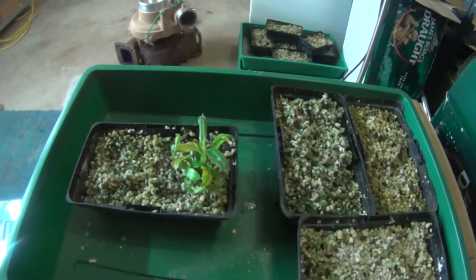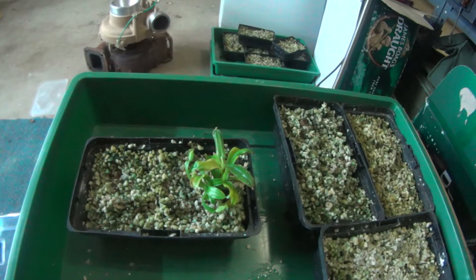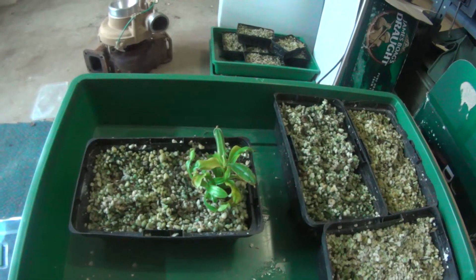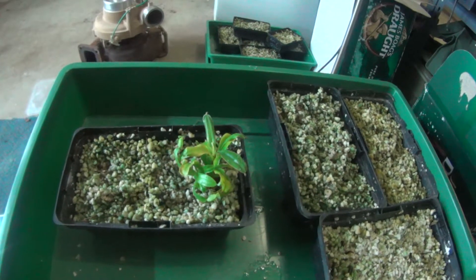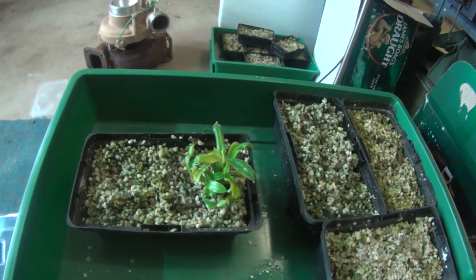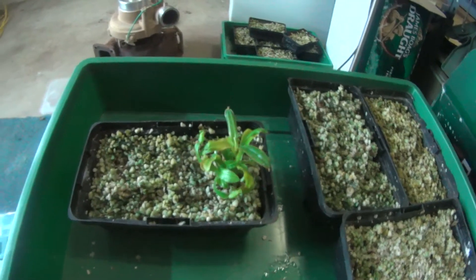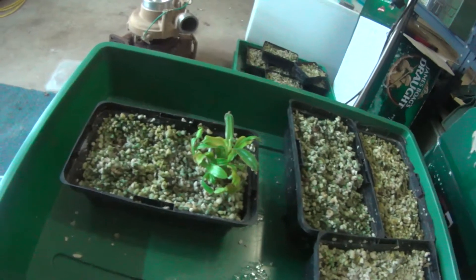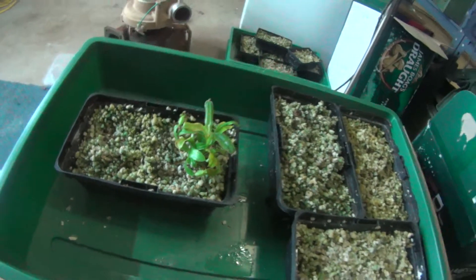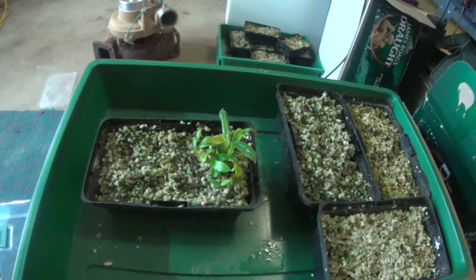You've really got to pay close attention at this stage. This is probably the most critical part where I tend to lose most of my plants, if I'm going to lose them — just by exposing them to too much air, or letting them get a little bit too much direct sun, and it dries them out very quickly, within a matter of minutes if you're not careful. Anyway, that's how I go about hardening my plants off. Thank you.